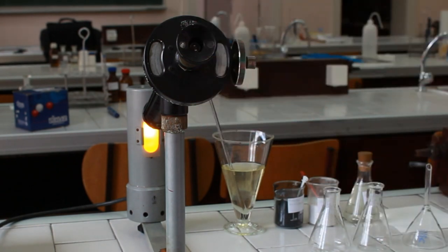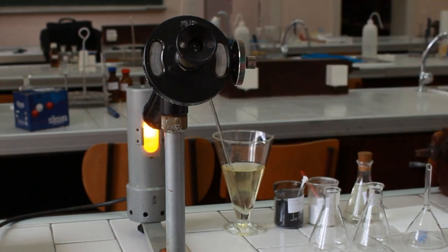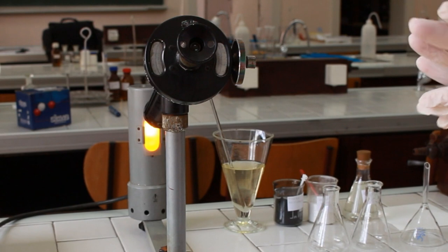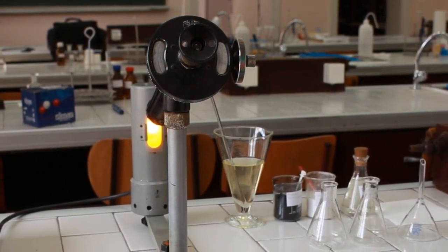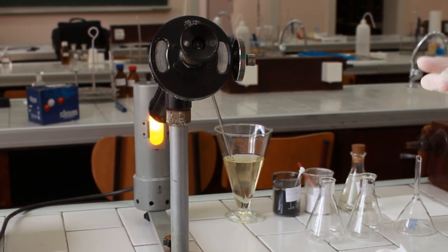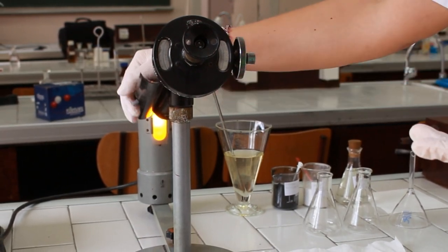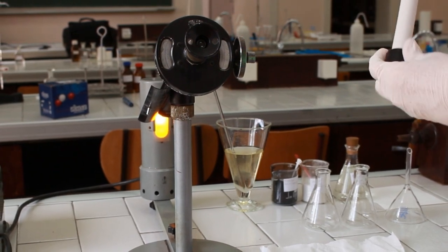Here we have an ocular and a scale at which the angle is determined. Before we start with any experimental procedures using the polarimeter, first we need to adjust it to zero. For that purpose, we need to use a solution of a non-optically active substance. The commonly used substance for such an adjustment is simple distilled water.